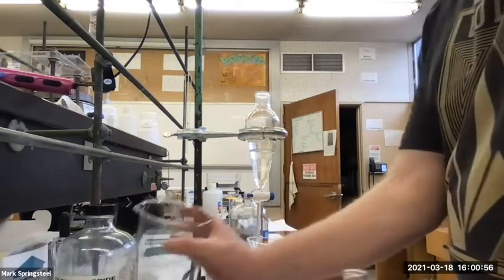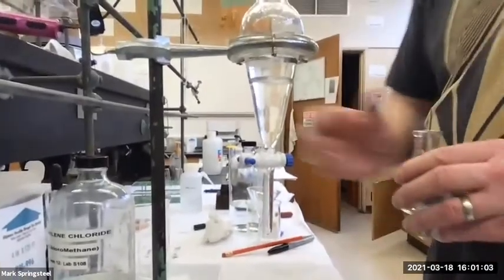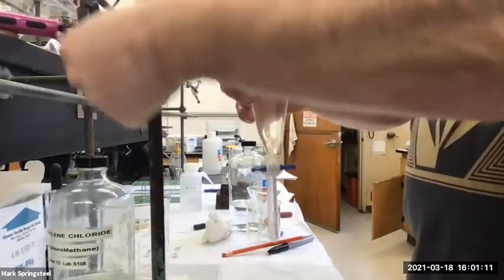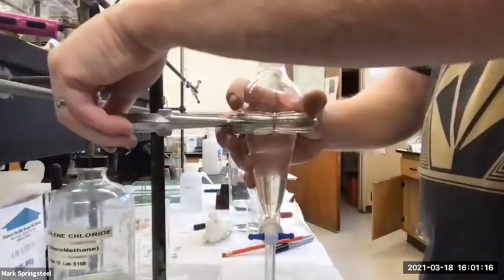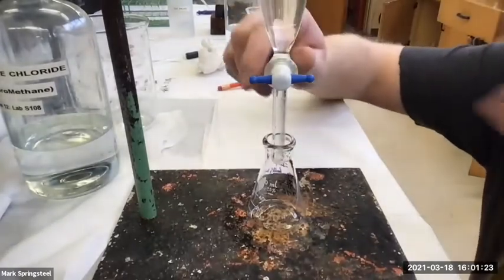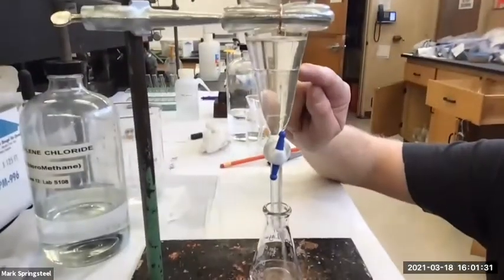Okay. And now I'm going to drain that organic layer. I got to move my beaker out of the way, but it's okay because I'm going to be purposely opening the stopcock now. So actually it's best to have it on the counter. Okay, there we go. Let me get you a better view. So I'll start opening the stopcock and I'll start to drain out that lower layer. And I'll let you watch as I go. So I start off. Can you see? Oh, you can't see it yet. Can you see the organic layer coming down?